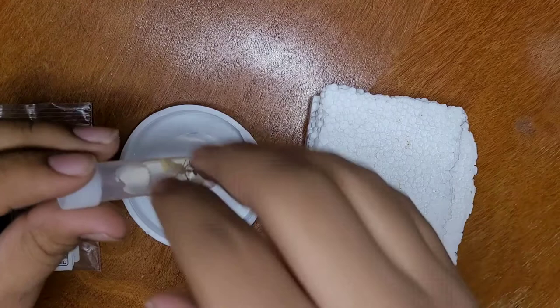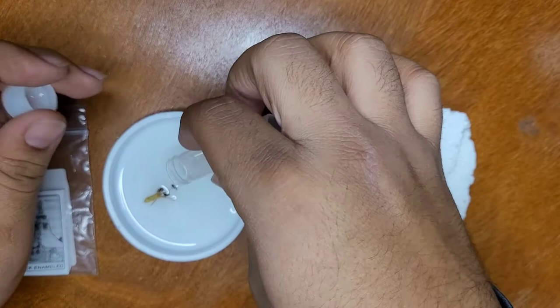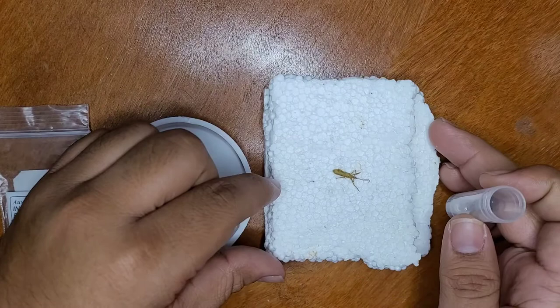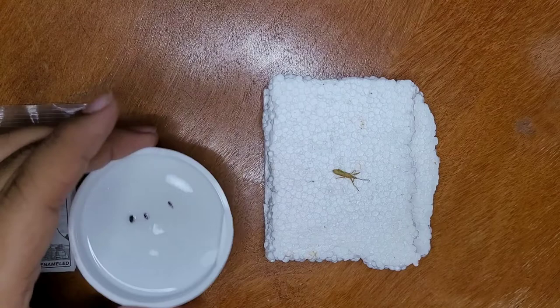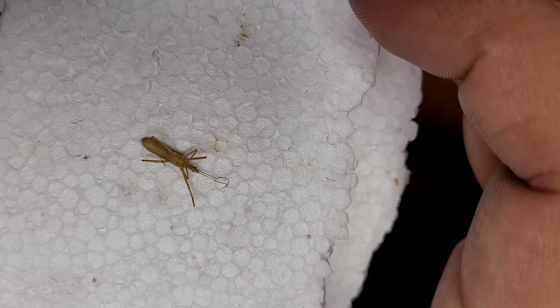We're going to use this piece of styrofoam in order to pin it. I'll begin by unscrewing the lid and pouring out the contents — these insects have been soaking in ethanol. Now all I have to do is pull out the one I'm going to pin. It's this lovely little bug right here — and it actually is a true bug, scientifically speaking.